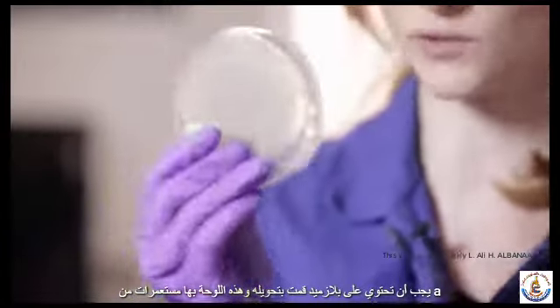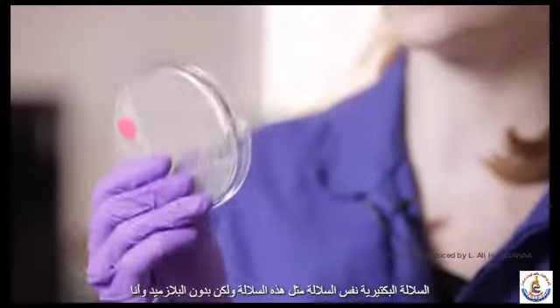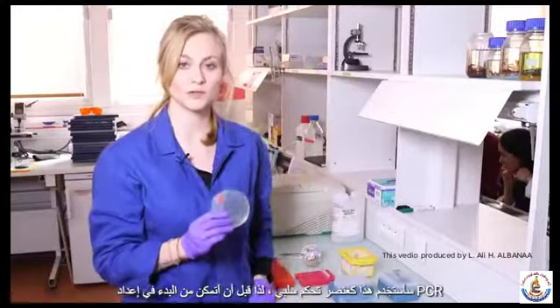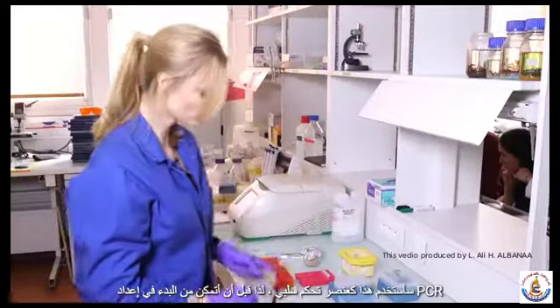So here I have 2 plates. One plate with colonies that should have the plasmid that I transformed. And this plate has colonies from a bacterial strain, the same strain as this one, but without the plasmid. And I'm going to use this as a negative control.